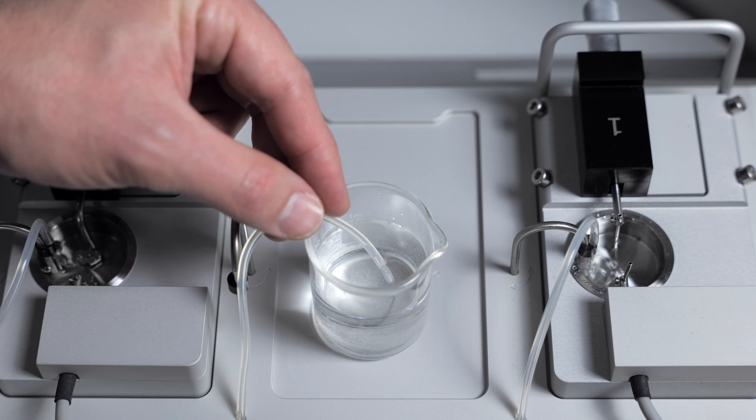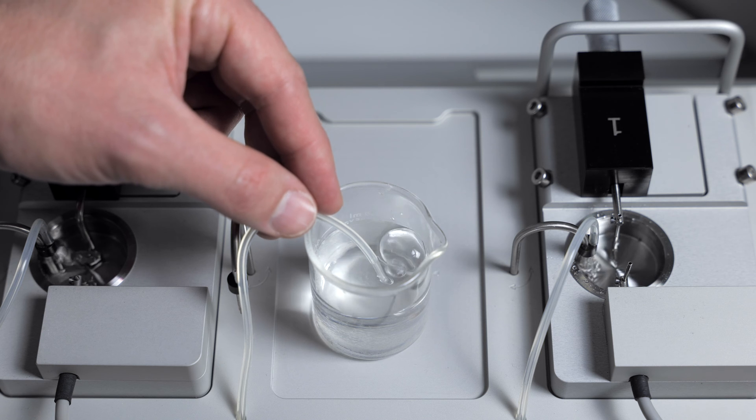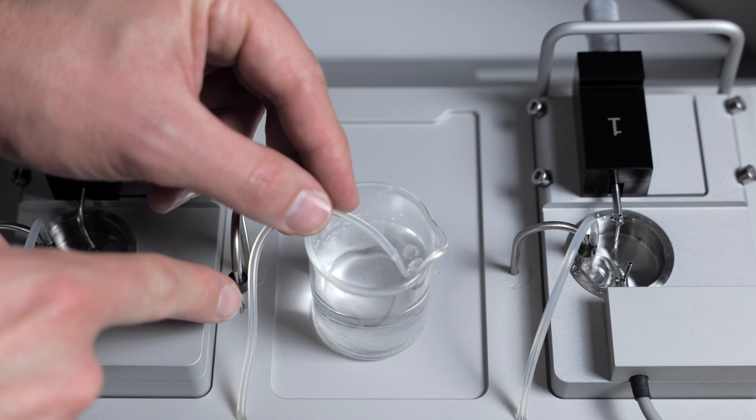If you have bubbling, as you can see here, then you know that the clog will be in this metal inlet pipe right here.